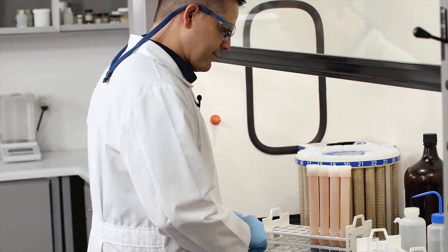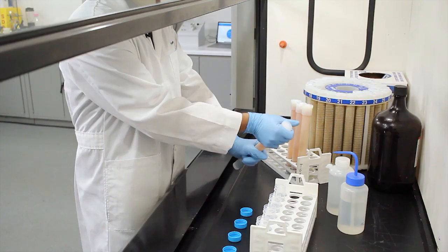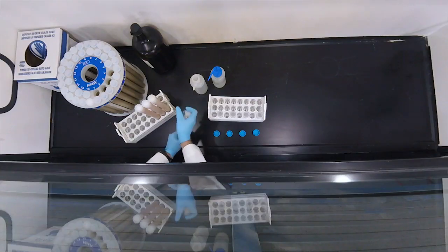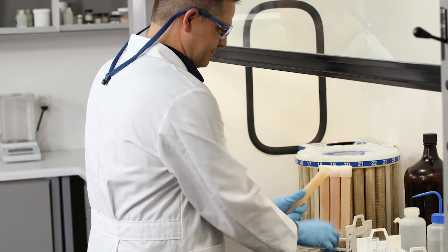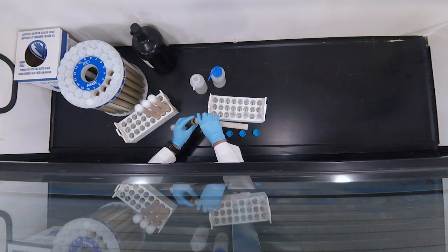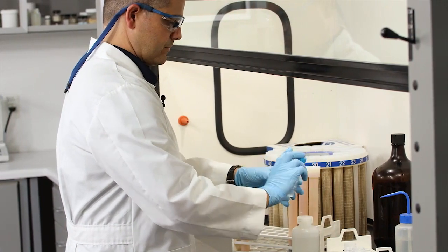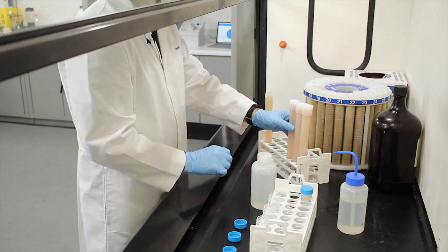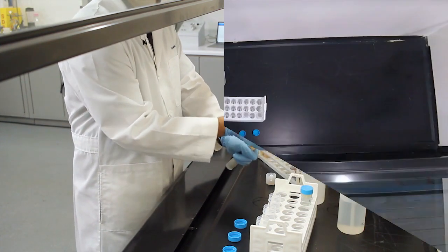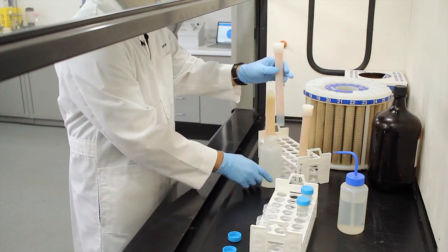Okay, now that the samples have cooled, I've pulled out vessels one, three, and four. Let's take a look at them. Look at all that gas - all that good NOx and CO2 generated during our digestion. This is our peanut butter. Everything looks good. Now it's time for our beef jerky - more good gas. That looks nice as well.